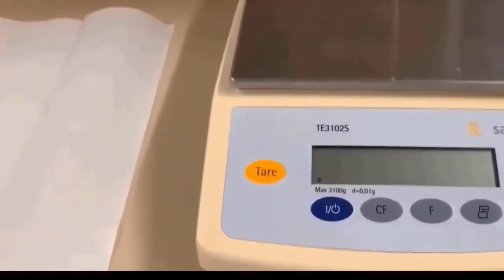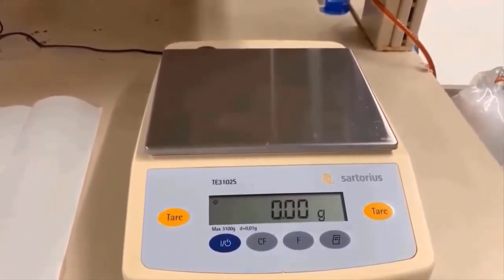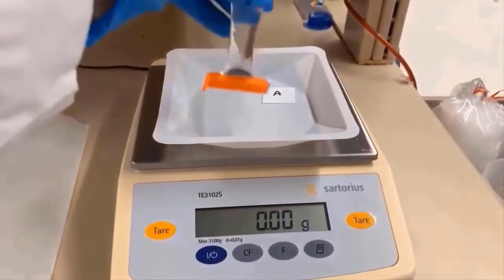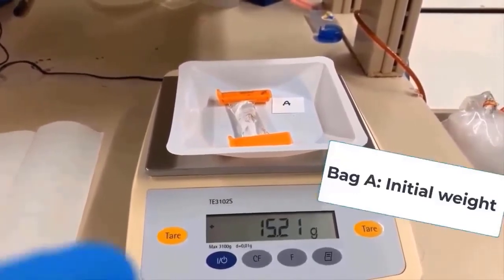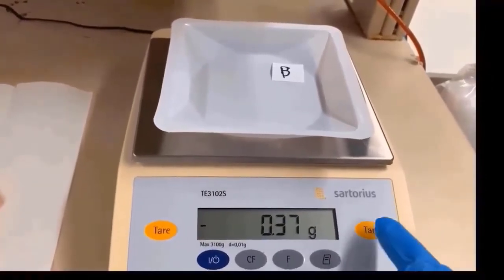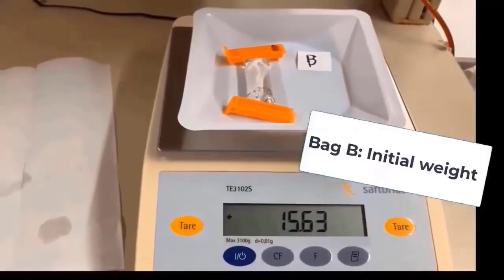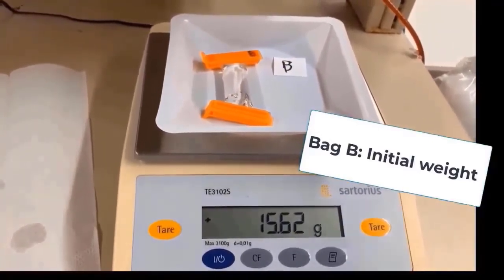This is my balance. First I need to turn it on. I will put a weigh boat here, then I need to set this balance to zero. Now record the initial weight of bag A — that is 15.21 grams. We are going to measure the initial weight of bag B, so let me set this to zero. The initial weight of bag B is 15.62 grams.